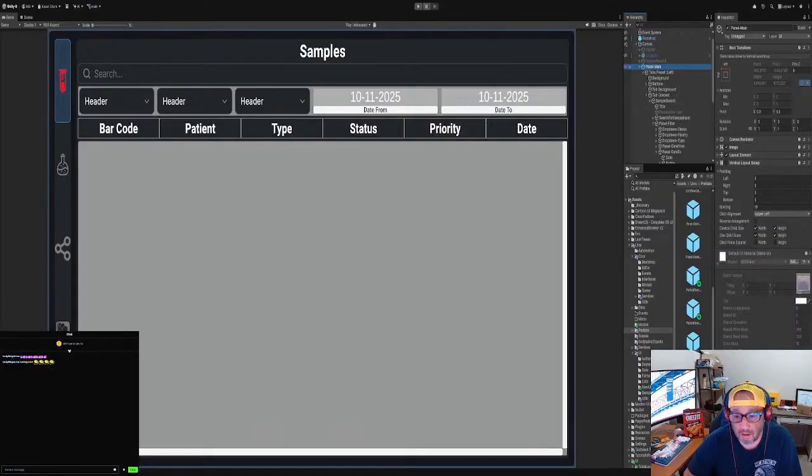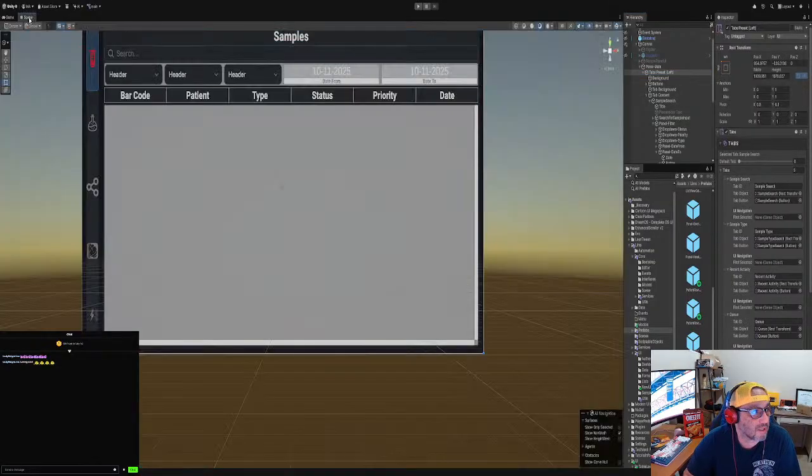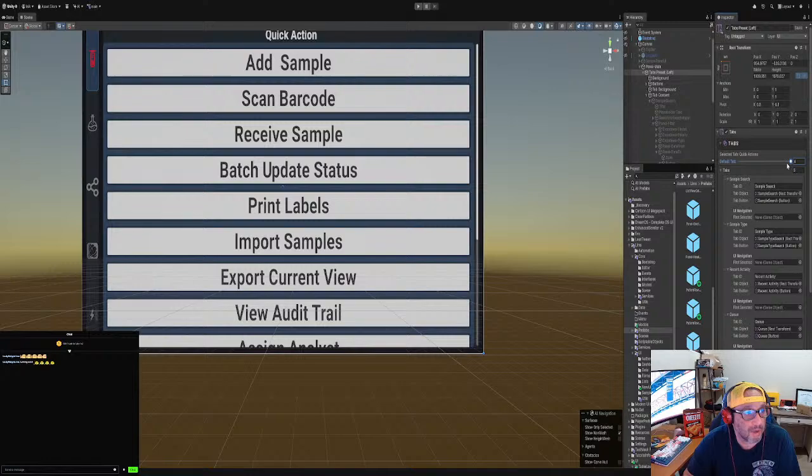And I did vertical for these side menus right here. And so I just went to the tab and I added the sample search for the tab. Now this is how you work it. So you go here, I believe, oh, here goes. So the tab, see how it moves it for you automatically.